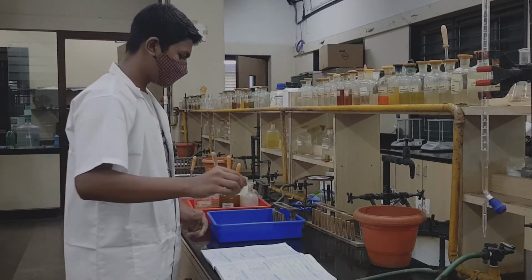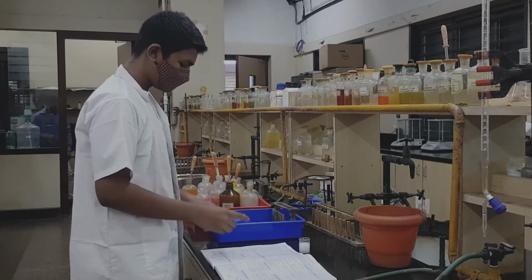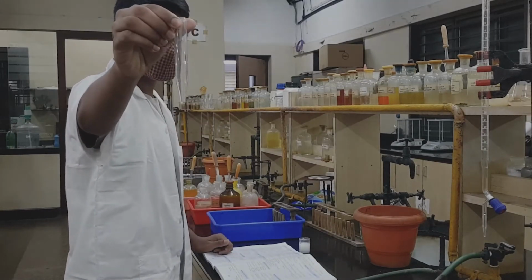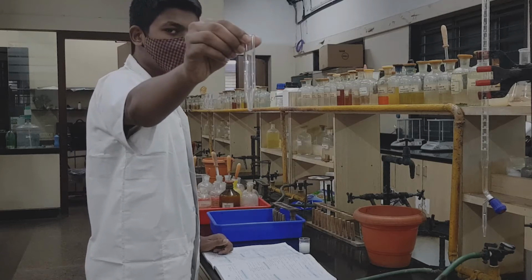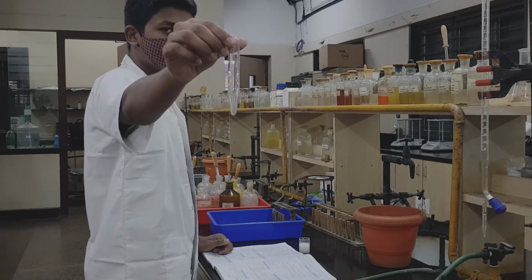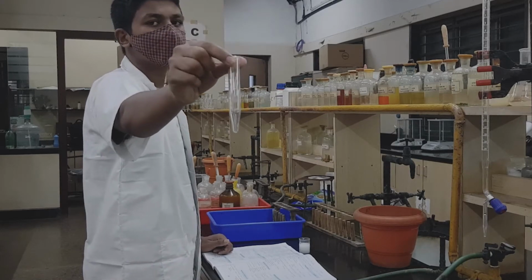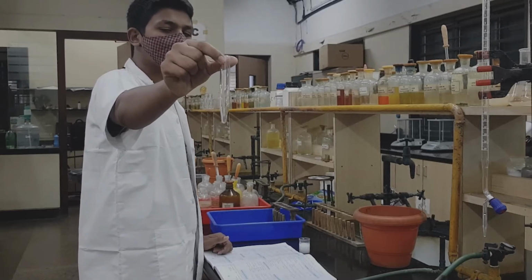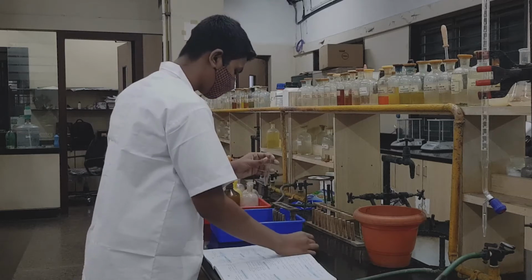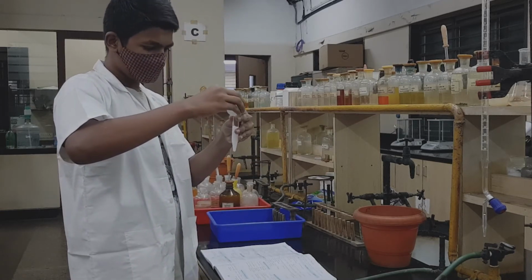Now, we need to centrifuge this, that means separation of the PPT from the entire solution. So, we take a centrifuging tube. The centrifuging tube is slightly narrower at the base; it is not exactly a test tube, it is a different type of tube in which the base is narrow, and this has to be balanced in the centrifuging machine. So, you shake the beaker and transfer the PPT into the centrifuge tube.